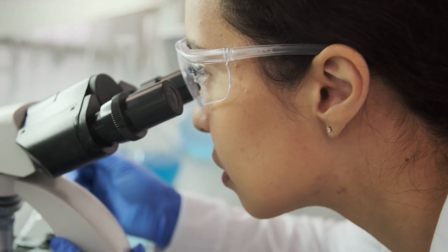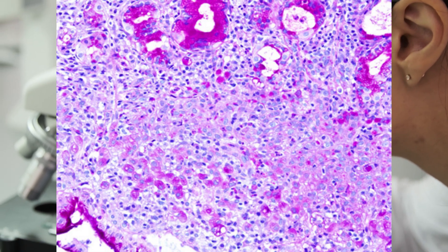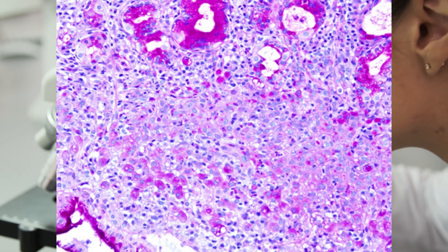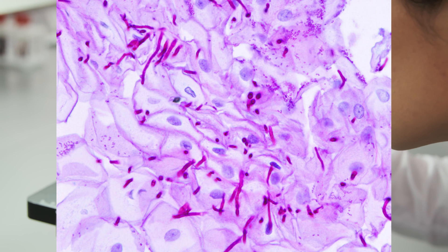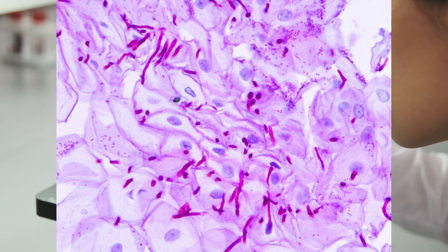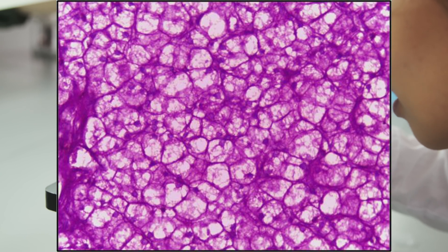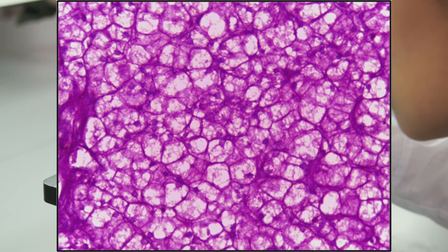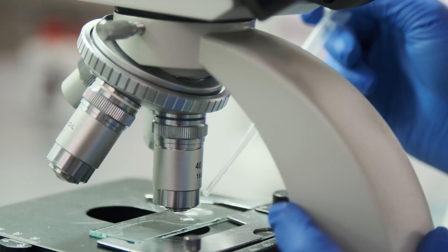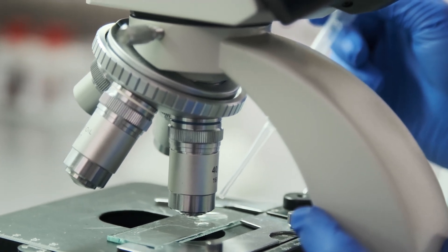Moving on to less common options, there is the periodic acid–Schiff reaction, also given by the acronym PAS. This is used to look at structures particularly rich in carbohydrates — things like sugars within the intestine, renal cells, and reticular fibres, which tend to take up the stain more readily. Glycogen, glycoproteins, glycolipids, and mucins stain red or magenta when the staining process is completed. It works entirely based on sugar molecules producing aldehydes — hence the name, periodic acid–Schiff reaction. Without the reaction, you don't get the necessary red-magenta colour.